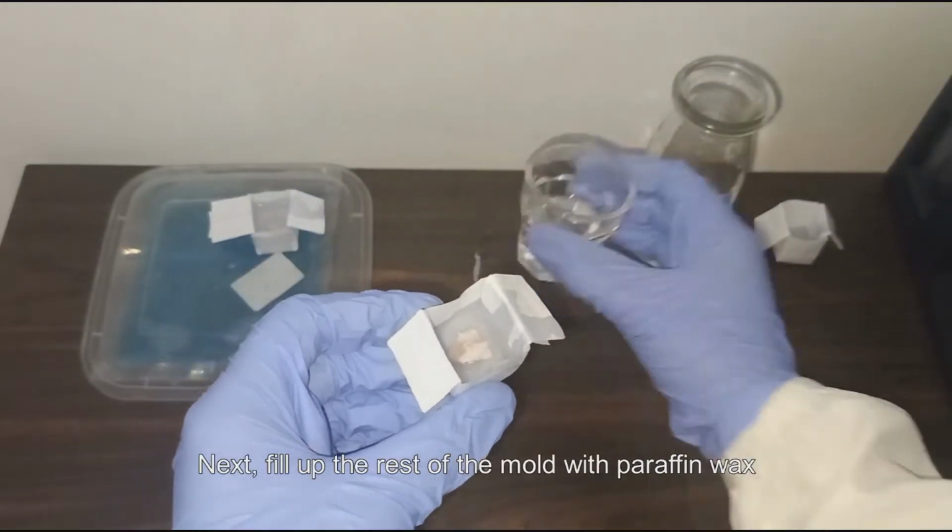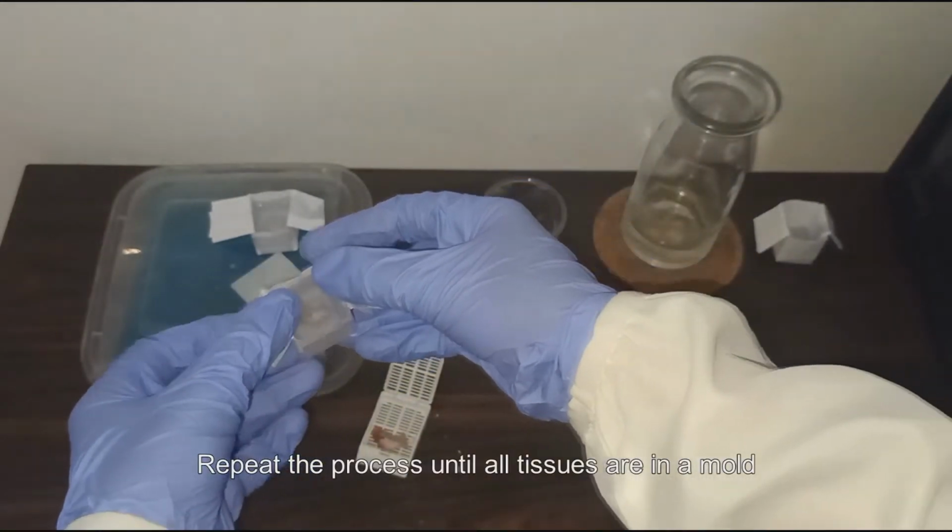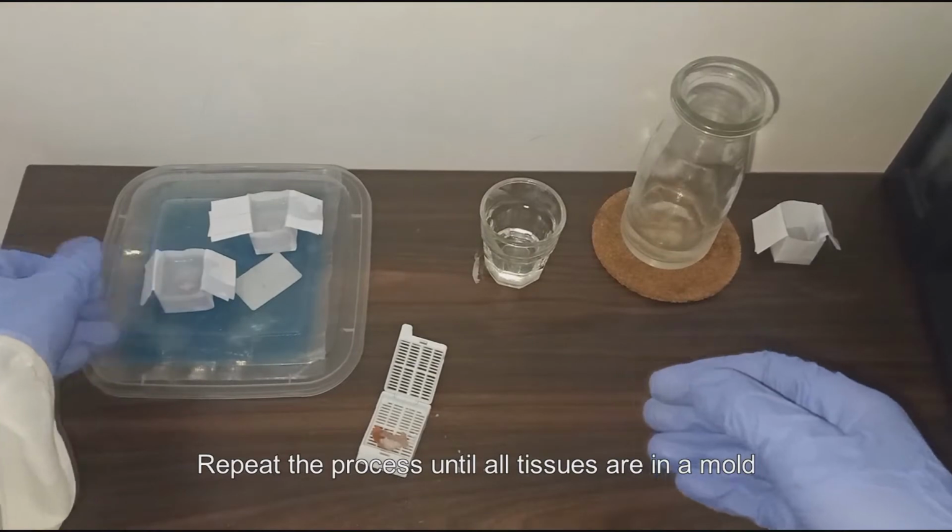Next, fill up the rest of the mold with paraffin wax. Repeat the process until all tissues are in a mold.